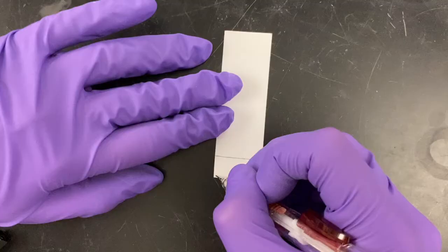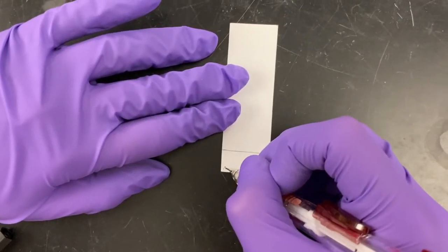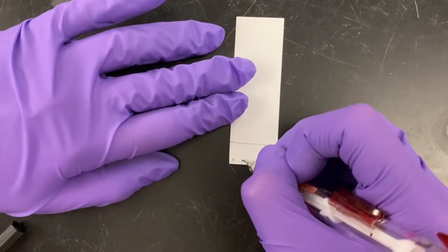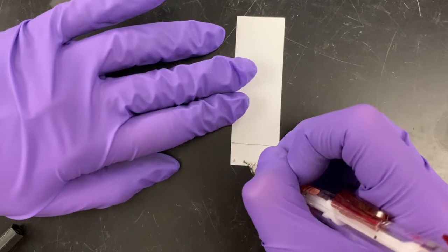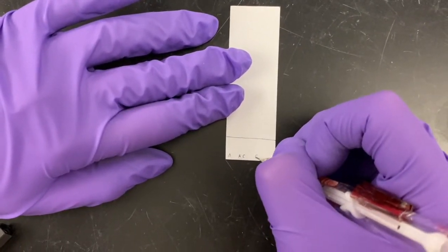Make sure you are wearing gloves for this step. Also, be sure to label each lane so you know which compound will be put where.